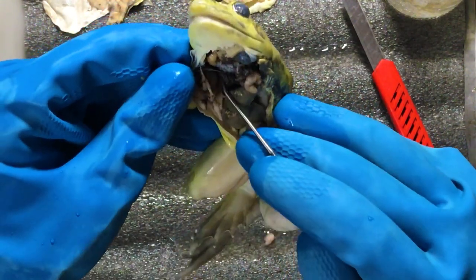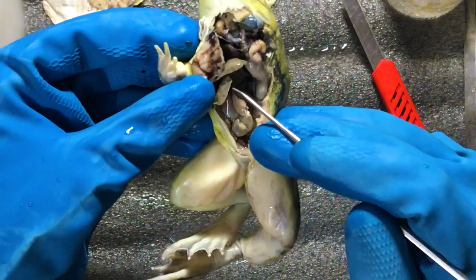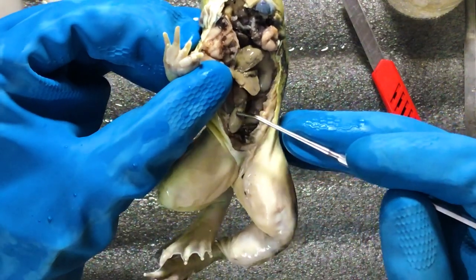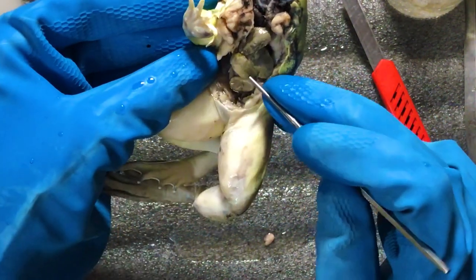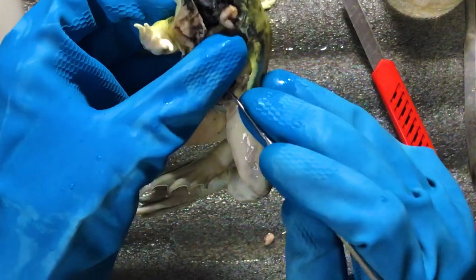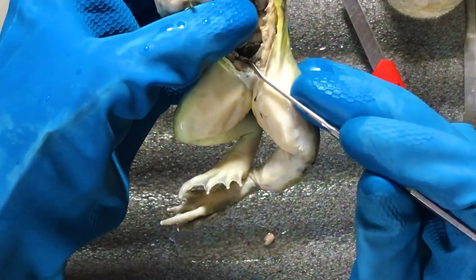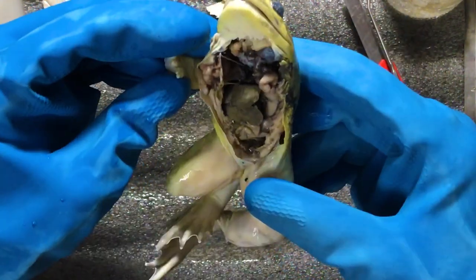It's quite difficult but this is the right lung over here. And here comes the stomach, the small intestine inside this, behind the liver, and this is the large intestine. And finally the kidneys are here — these are the two kidneys — and finally the anus over here.